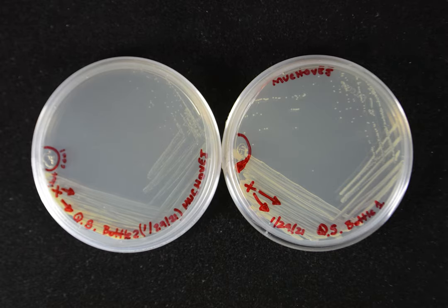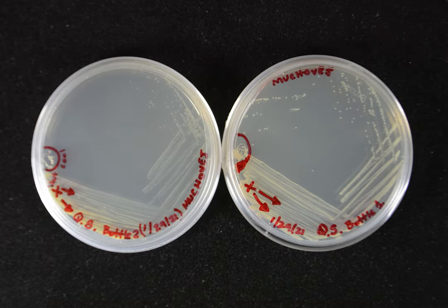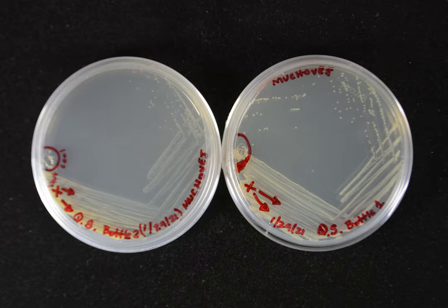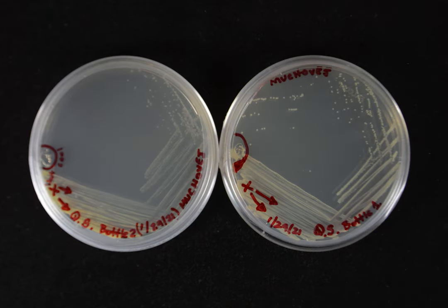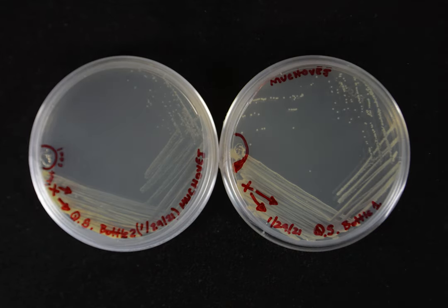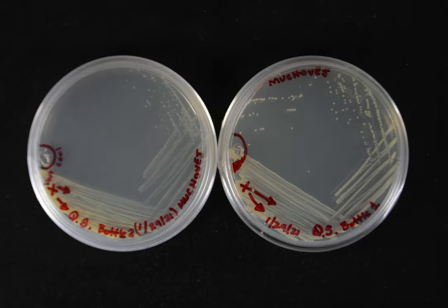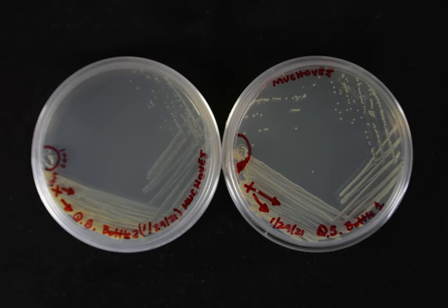These come from individual CFUs — colony-forming units — which arise from single cells. These can then be aseptically transferred to a new agar medium, resulting in a pure culture.